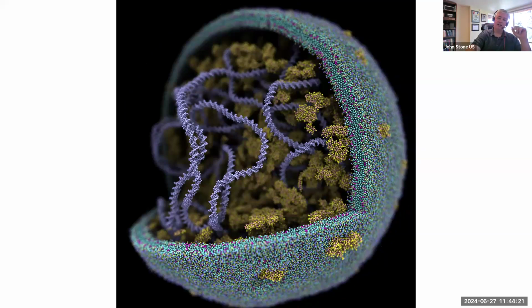I think my total time spent, it took me longer to download his files because it's a 100 million particle simulation. It took me longer to download his files than it did to turn it into a viable picture. And so I just did that as an exercise to show others what you could do, even if you don't know these details up front.